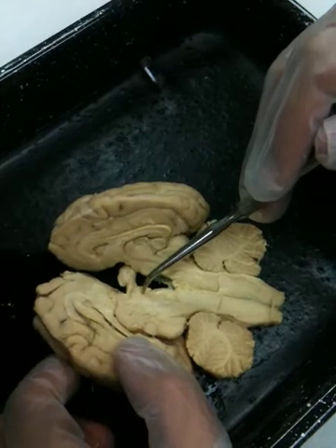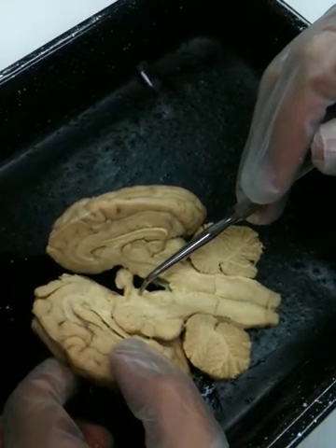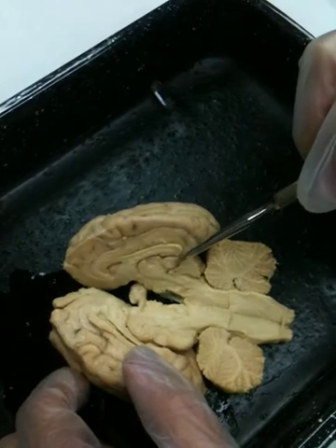The pineal body is quite a bit larger in the sheep than the pineal body is in humans, relative to the proportional size of the brain. This is the one other round structure right here. This is one half of it, as we slice through it by making a sagittal section.